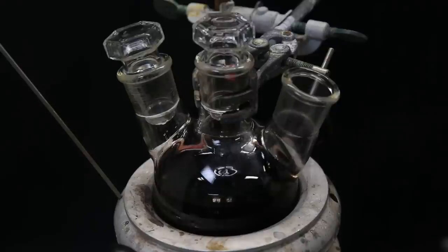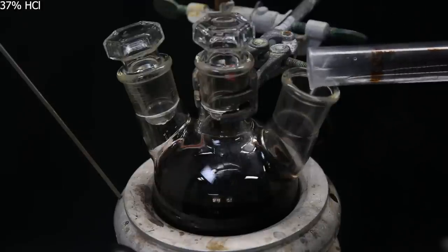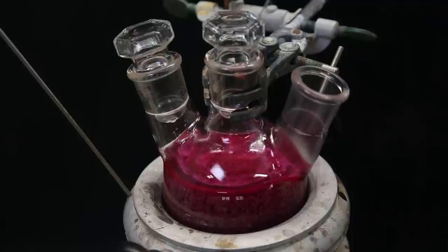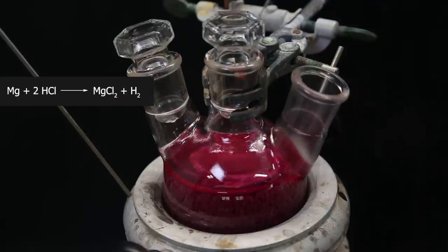I then remove all of the adapters, and gradually add concentrated hydrochloric acid to the mixture. The mixture begins to bubble from remaining magnesium metal, reacting with the hydrochloric acid, to form magnesium chloride and hydrogen gas.